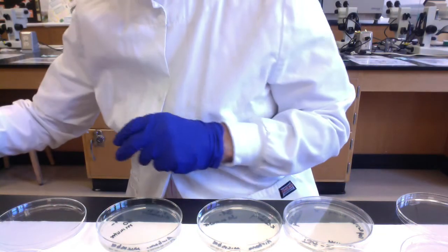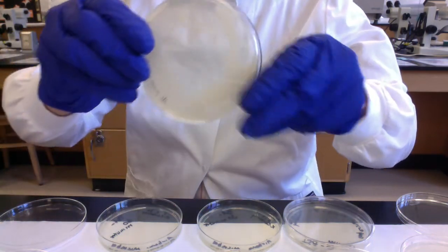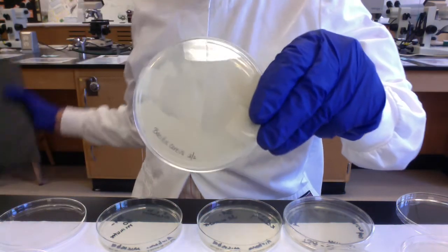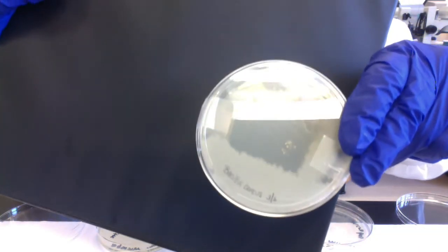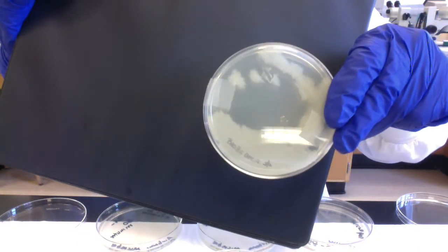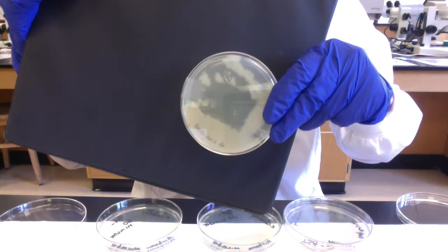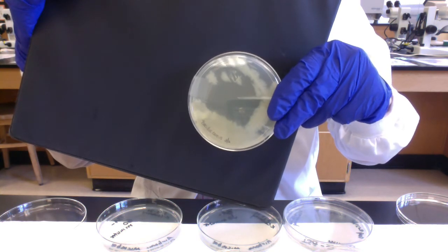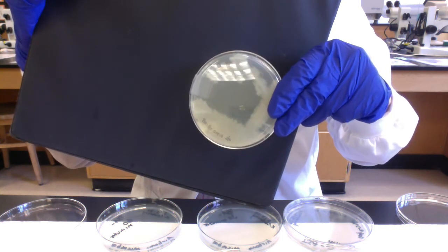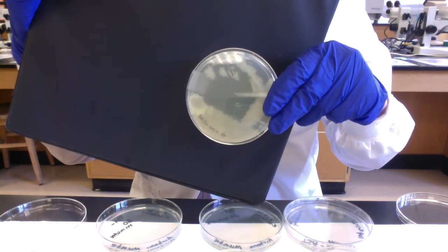In contrast, folks, this is a gram-positive cousin of Bacillus anthracis. Okay, this is Bacillus cereus. And you can see, or maybe you can't see. Wow, that isn't too good, is it? Not sure if you can see this, folks, but you can see the colonies. They have a different size, shape. They're not pigmented. If we could see this better up close, we would see that the surface of the colony is relatively rough.